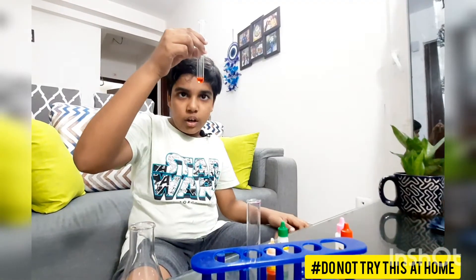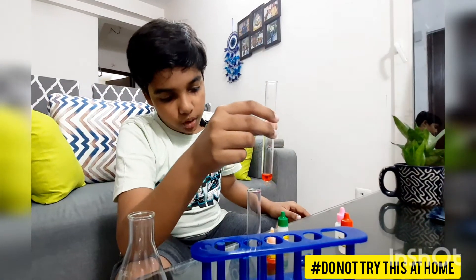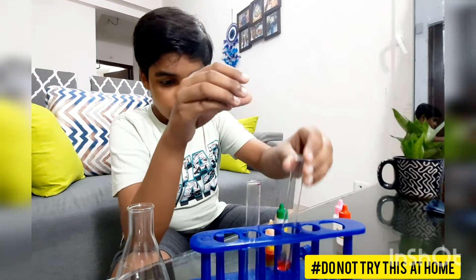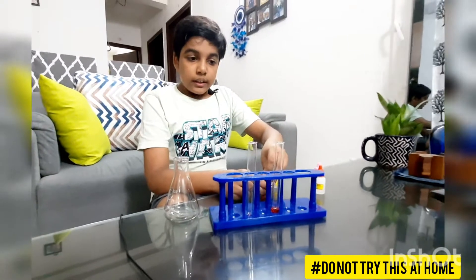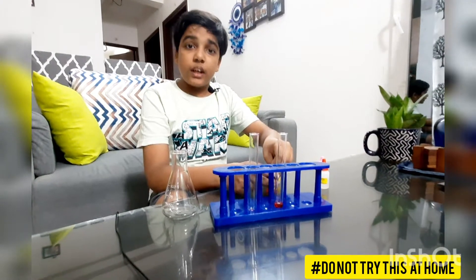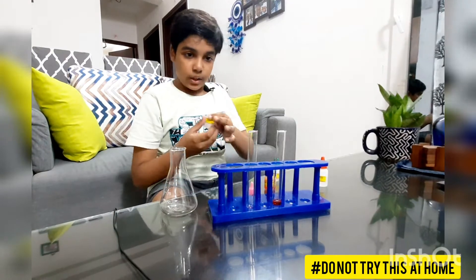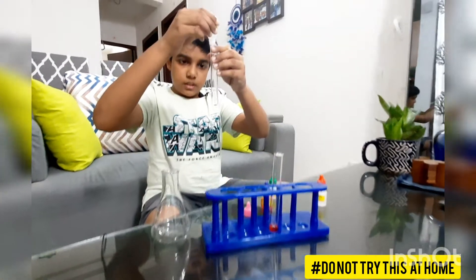The color has changed to red, which means that the amount of acid present in it is more. Now I would like to show what the color will be when a methyl orange indicator is applied to a base, so first I will put a base in it.